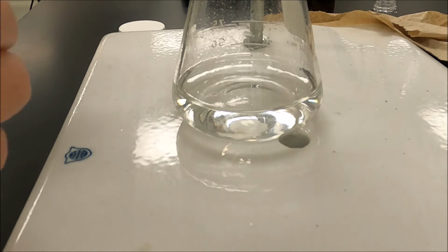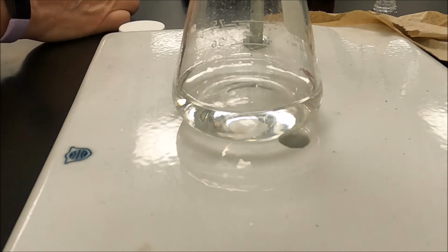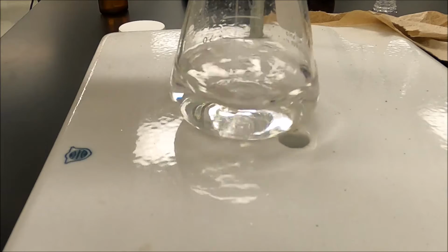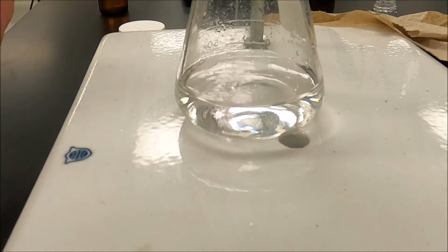Just to be on the safe side. I'm waiting for my pink color to start showing up.